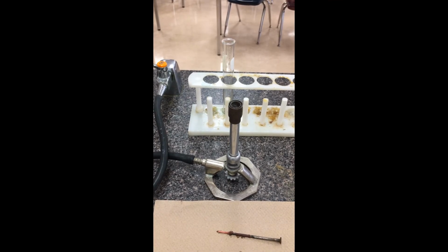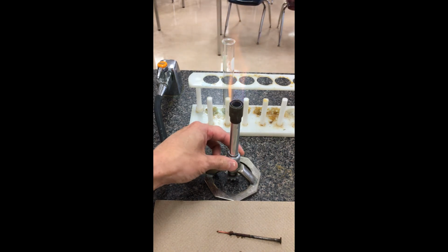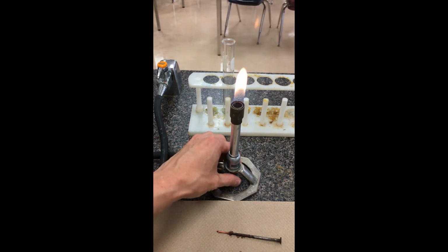Okay, and just showing you what a flame dry could look like here. So I pulled out our Bunsen burner, and I'm just going to strike it. Currently it's on the blue flame setting. It's almost invisible to the naked eye. You can twist it back to an orange flame. I don't need it overly hot. Because I'm going to be holding this test tube over top of the Bunsen burner, you don't want to be holding it with your hands. I'm just going to lower the flame a little bit.